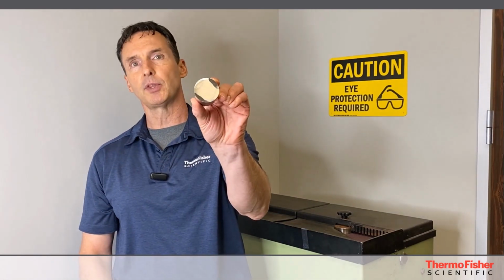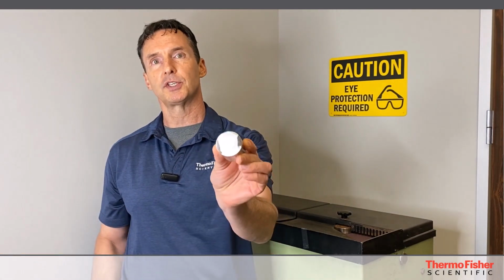Okay, so I'm standing here by our grinding wheel. You guys should have something similar like that in your labs if you do it manually. And this is Ton's sample. Now, this is a little bit extreme where she's got all these different facets as if she's trying to create a diamond out of metal, right? But that can be done with the same technique we're going to do with this. This is a more typical case where you have something where it's uneven, more on one side.